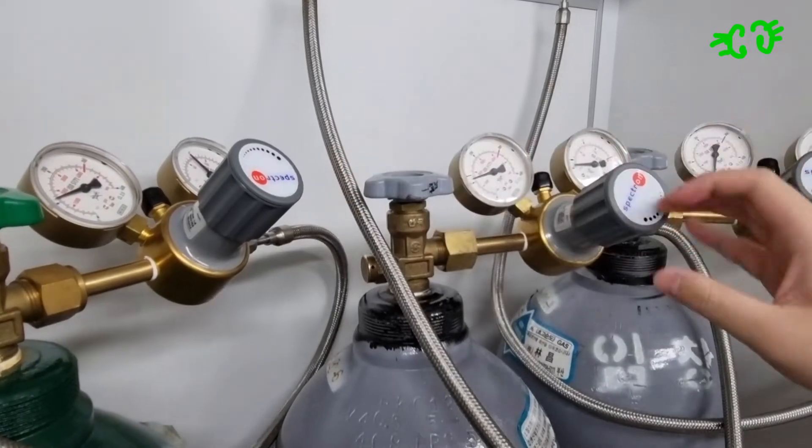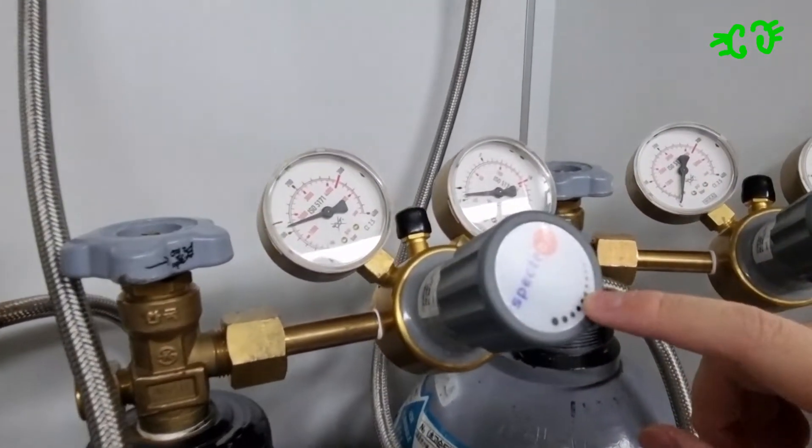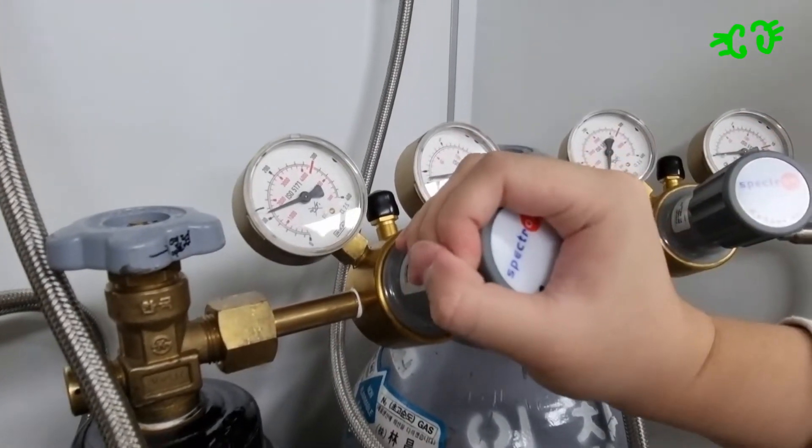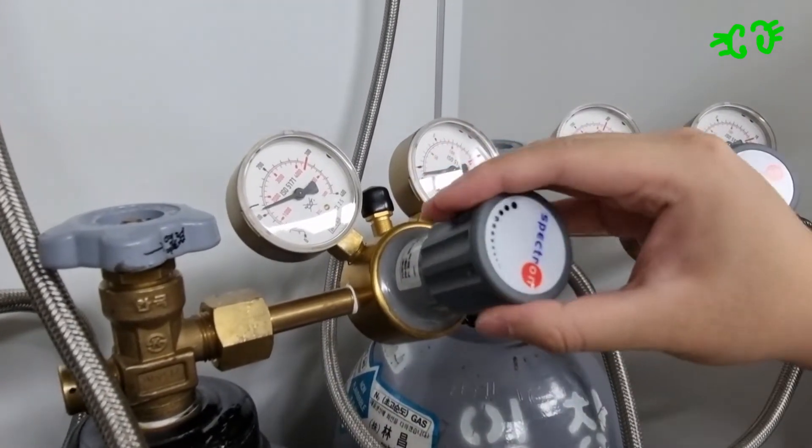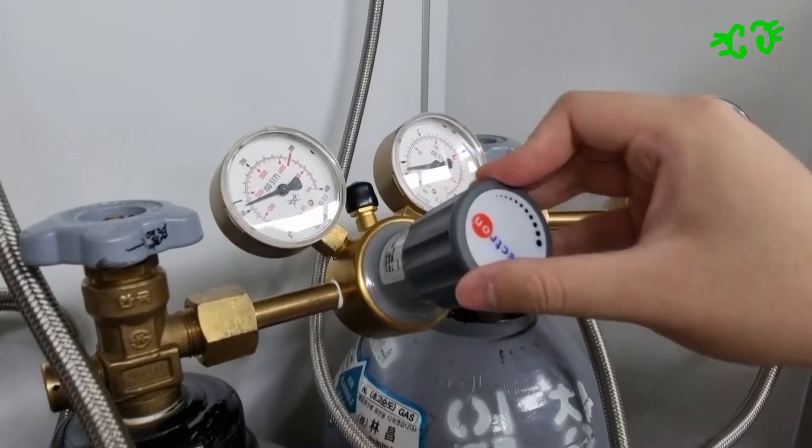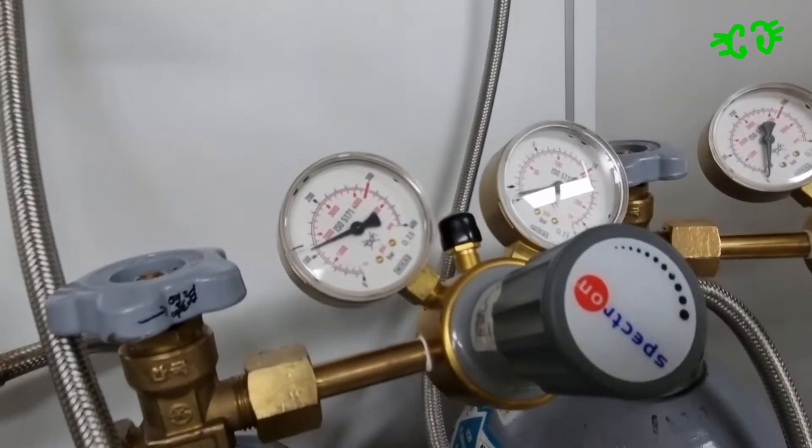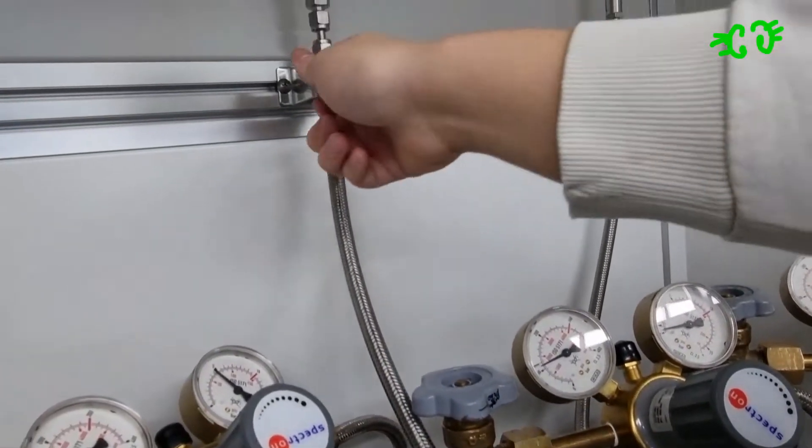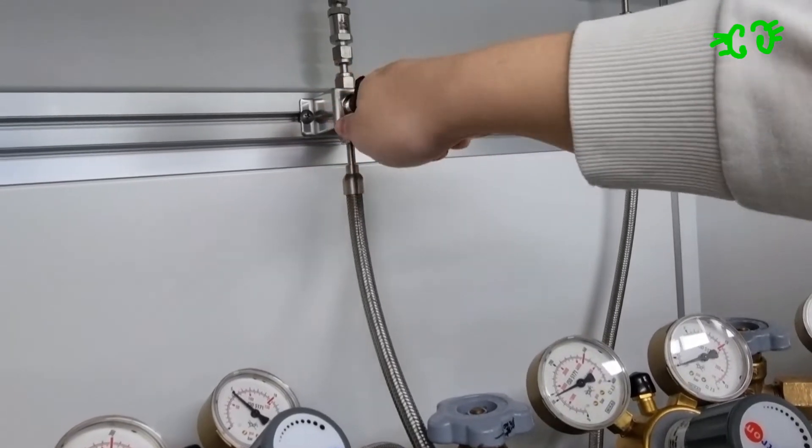And then this is the next valve you have to open. Okay, and this is the third valve. The third valve is from here, like this.